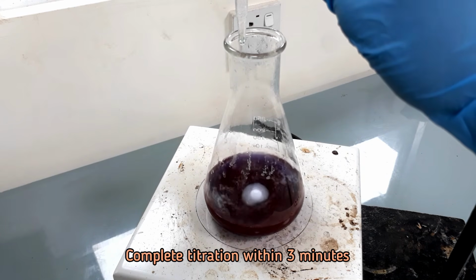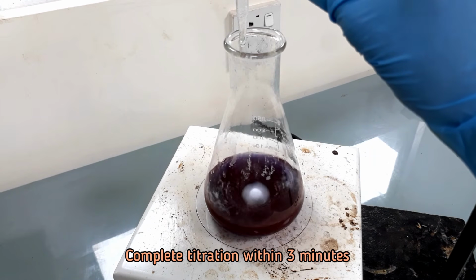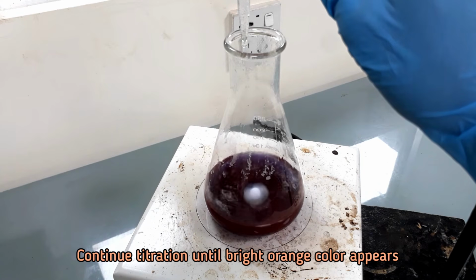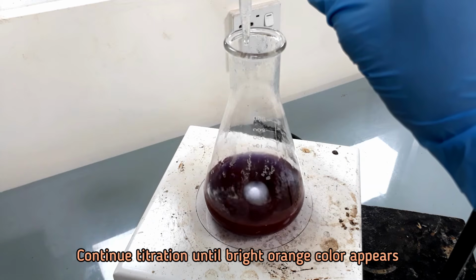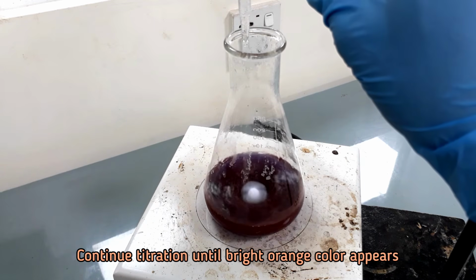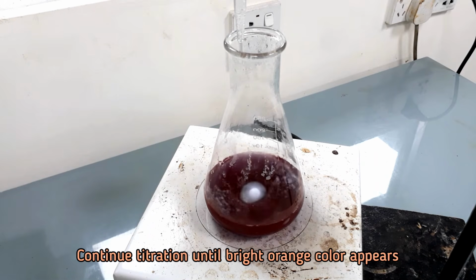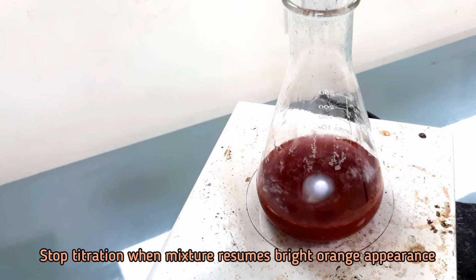In this way, complete the titration within 3 minutes. Stop titration when the bright orange appearance is observed.